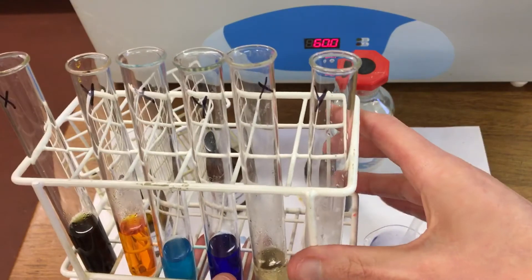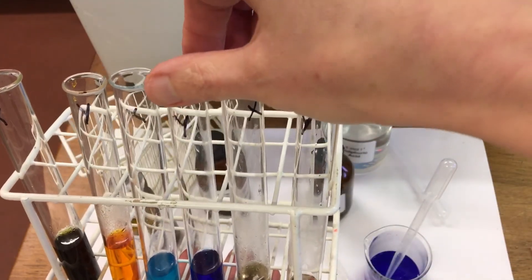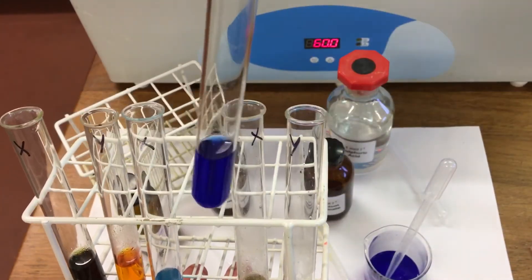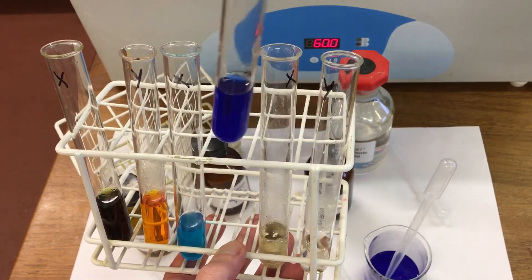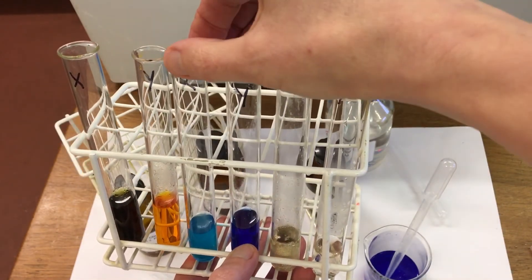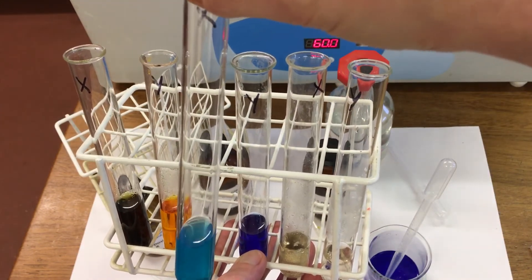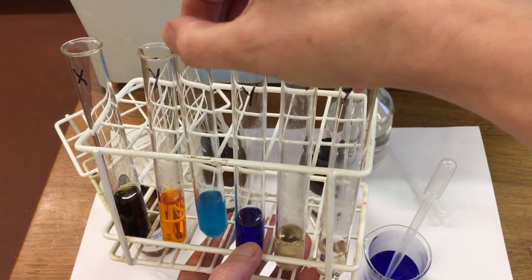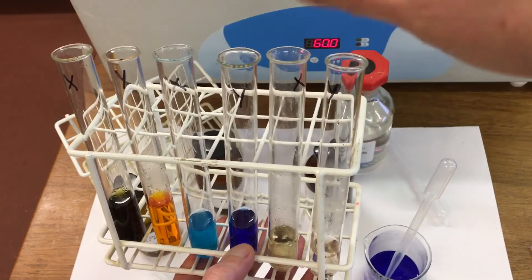The next one with Fehling's reagent: in Y it's the same color, so no color change there. But in compound X it's got a much paler blue color, so that one again has oxidized.